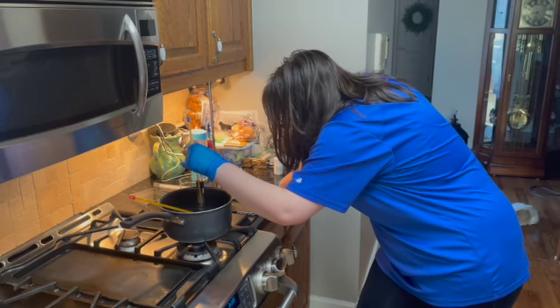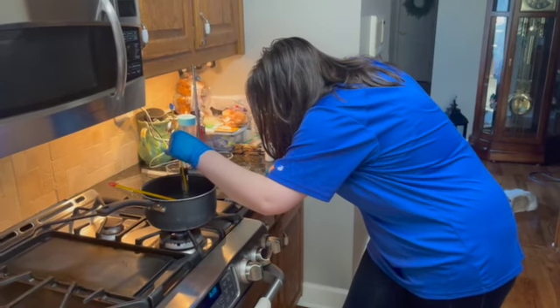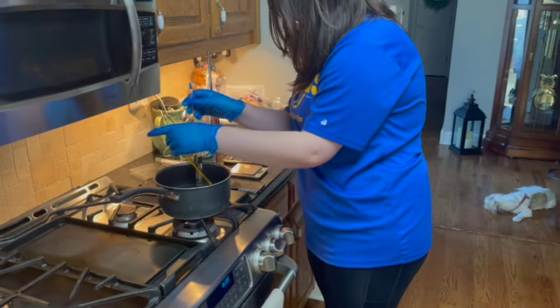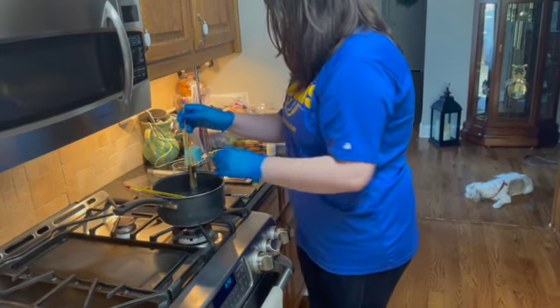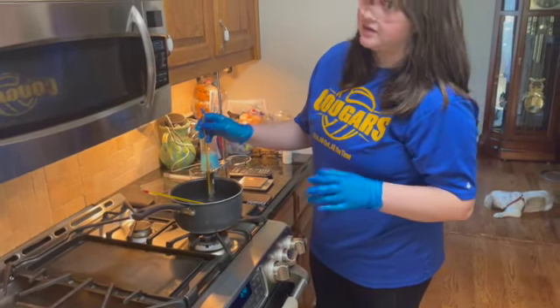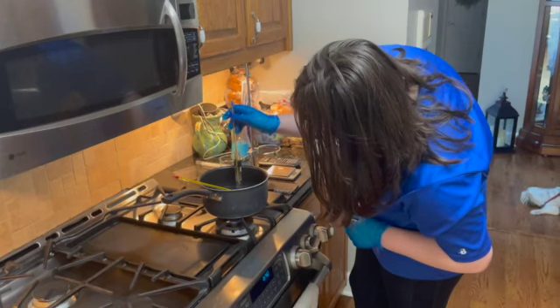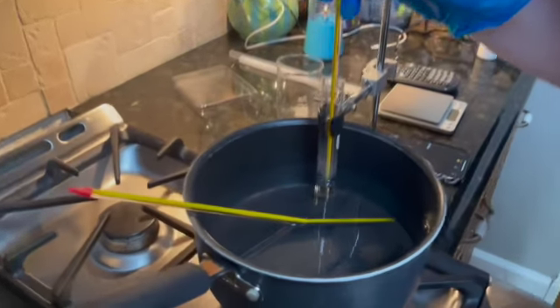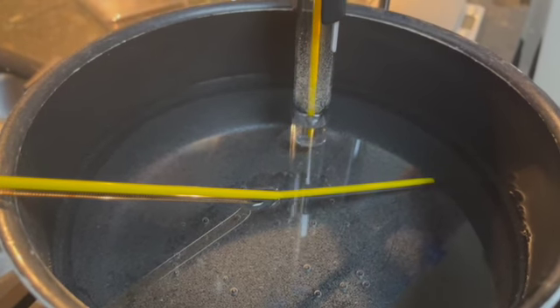So we are at the 19-minute mark, and our para-dichlorobenzene is at 55 degrees Celsius, while our hot bath is at 55 as well. So they're both on the dot, so they are either super close to each other, whether it's hundredths or even thousandths, or they're at the exact same temperature at this point. And it seems like there's barely anything left. There's still a little bit because I can still see it if I agitate just a little bit. So we've got to keep waiting until it's completely melted.